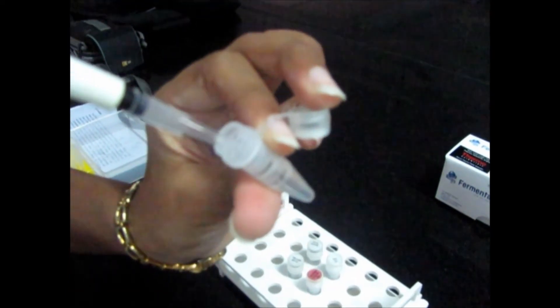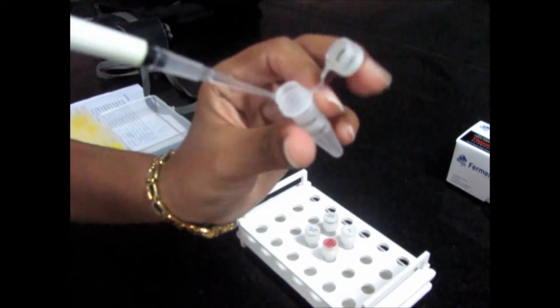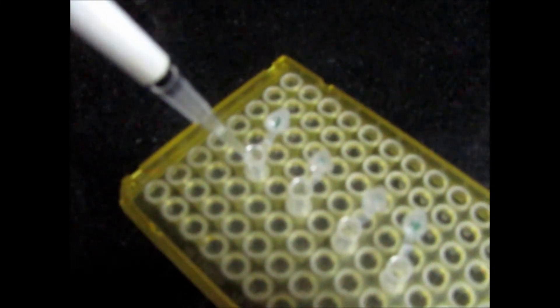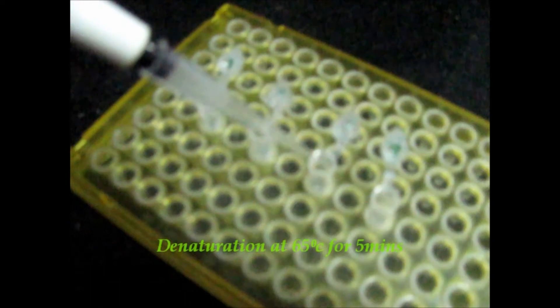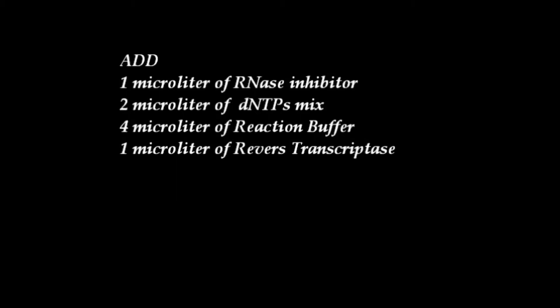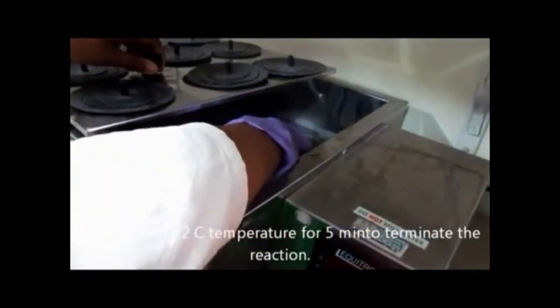cDNA synthesis is performed using the Fermentas kit. Add 3 µl of RNA to prepare the reaction mixture. Then add 1 µl of Oligo-dT primers and 8 µl of nuclease-free water, and keep in a water bath at 65 degrees centigrade for 5 minutes. Then add 1 µl of RNase inhibitor, 2 µl of dNTP mix, 4 µl of reaction buffer, and 1 µl of reverse transcriptase. Incubate at 42 degrees centigrade for 1 hour and terminate the reaction at 72 degrees centigrade for 5 minutes.